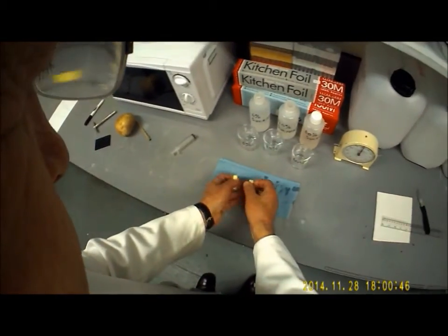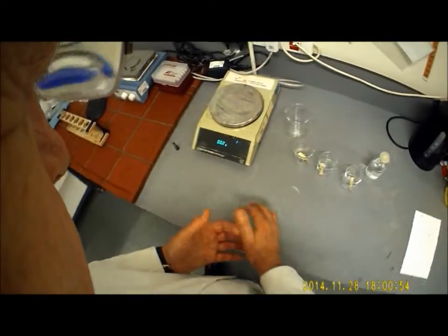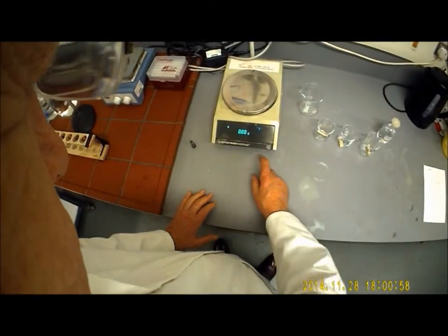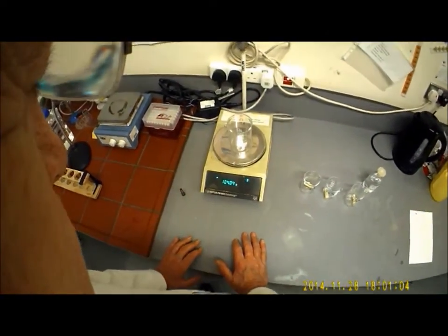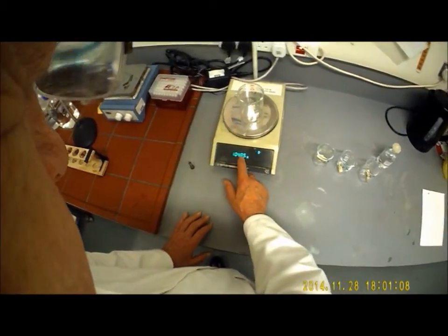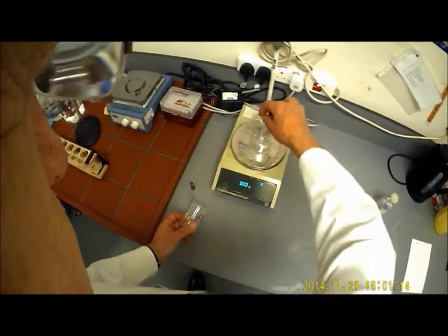So what we're going to do now is pop those into there and go and weigh them on the scales. So these are our laboratory scales. You may have to queue up a little bit. We've got 4 sets in the lab. First thing to do is we're going to use a spare beaker as a weighing container. I need to zero that because I'm not at all interested in the weight of the beaker. So this is our first core.